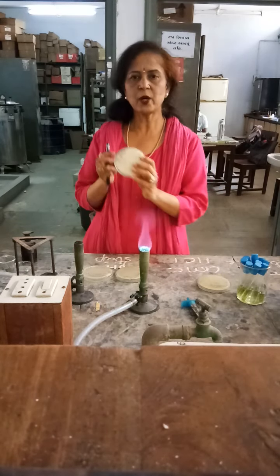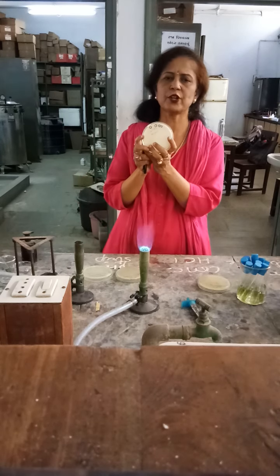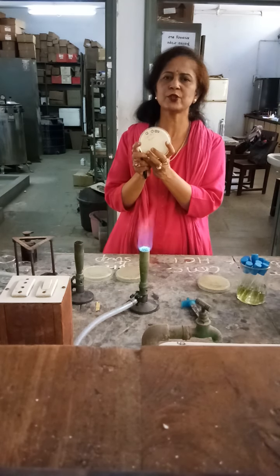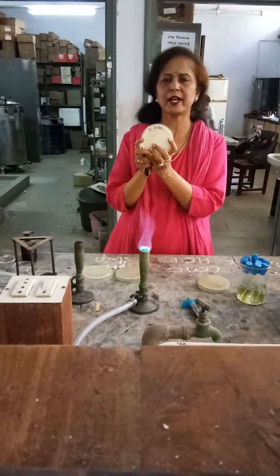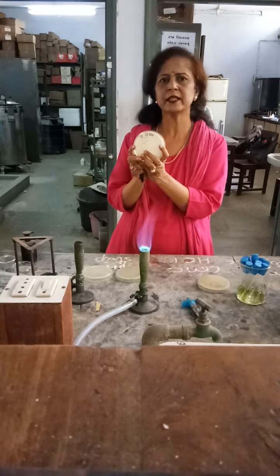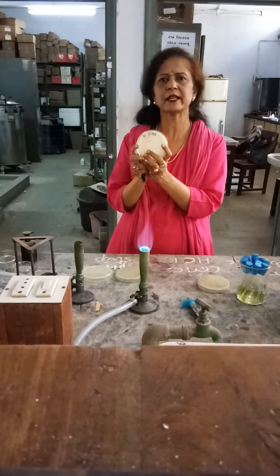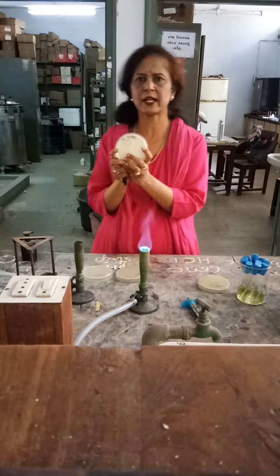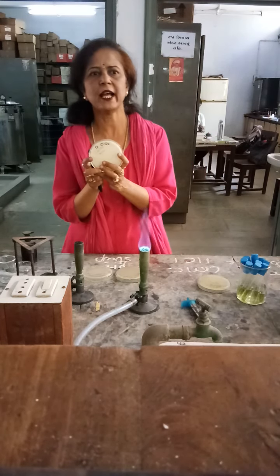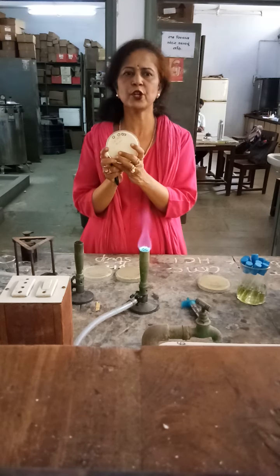Now, on the basis of gram staining and morphology, you can also clarify or identify the organisms, which may be gram-positive or gram-negative, having different types of morphology.